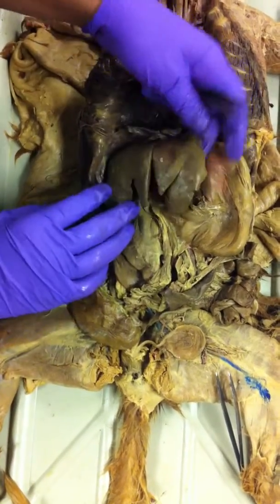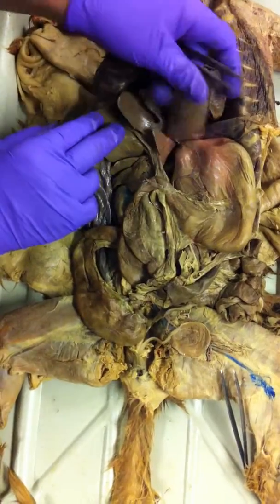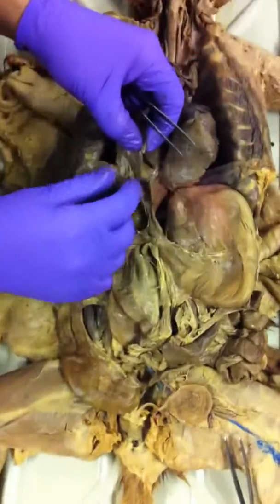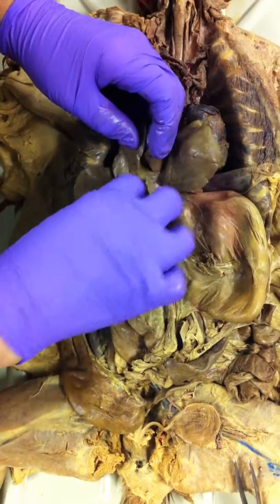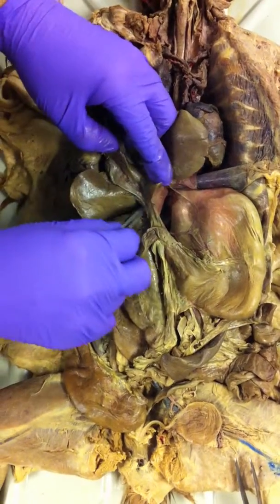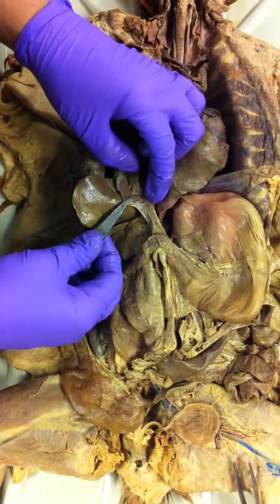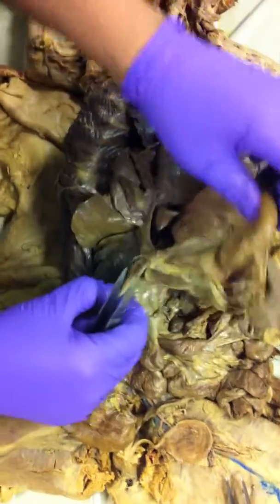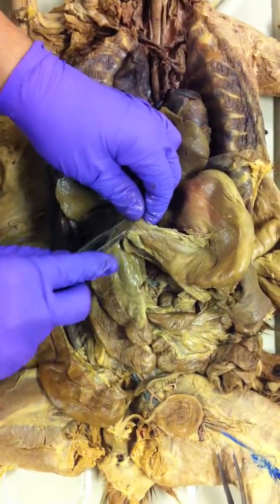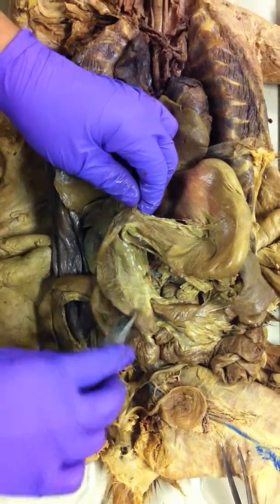This is your liver. Right? Left lobe, right lobe, caudate. And on the undersurface of the inferior part of the liver is your gallbladder. Right? This will be somewhere. It will be your bile duct, which opens into the duodenum. The stomach opens into the duodenum.